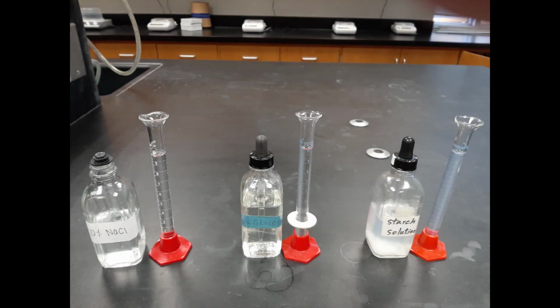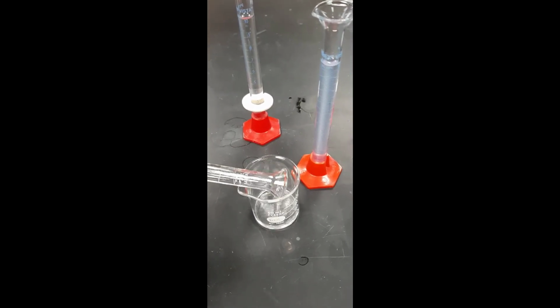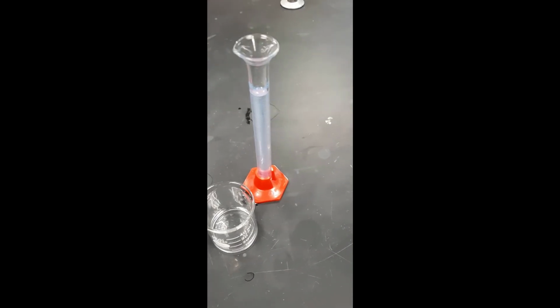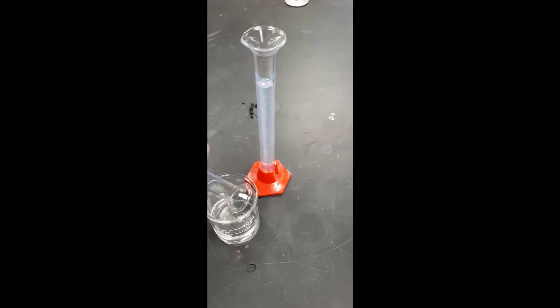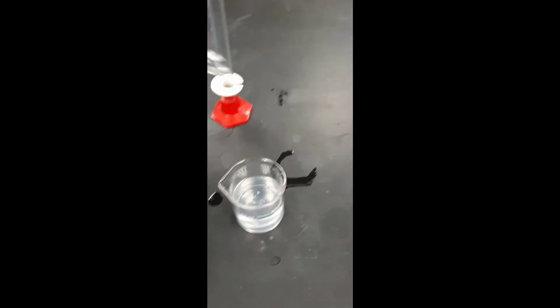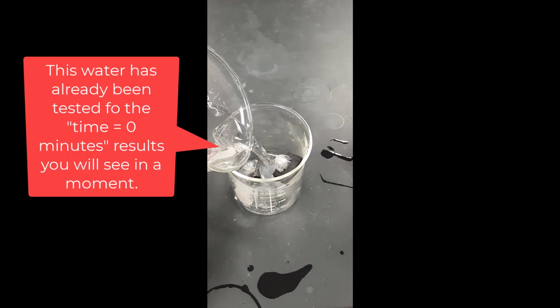Commencing Part B, here are the 3 solutions which will go into the dialysis bag. 10 milliliters of each solution are combined. Most of this solution is then poured into the dialysis bag. The dialysis bag is then immersed in deionized water.